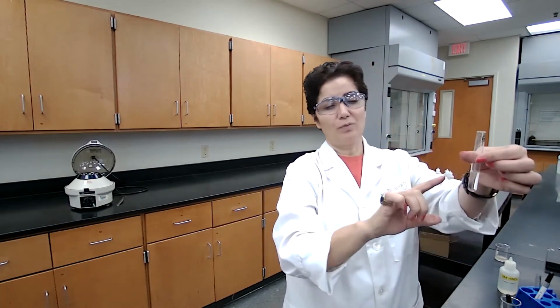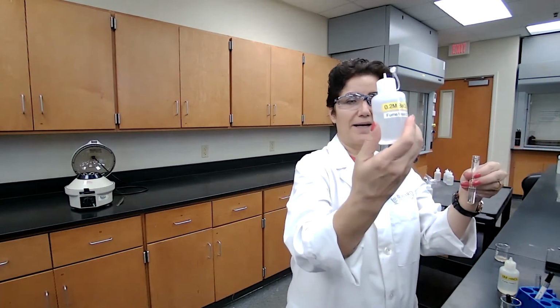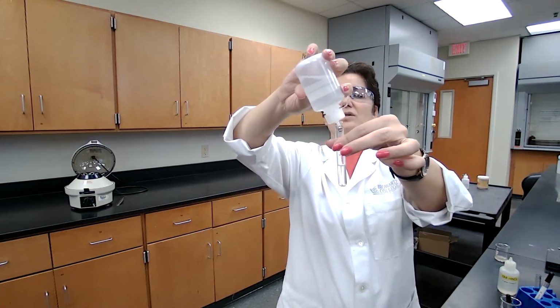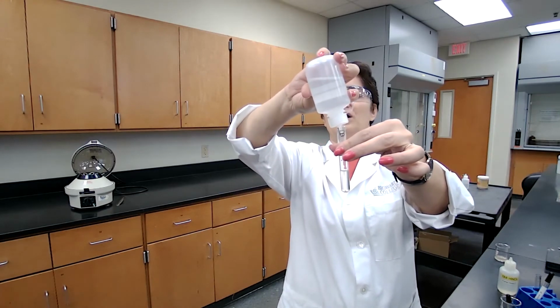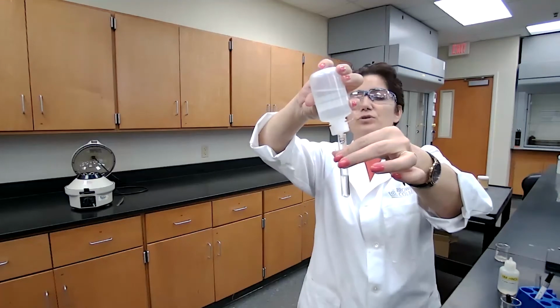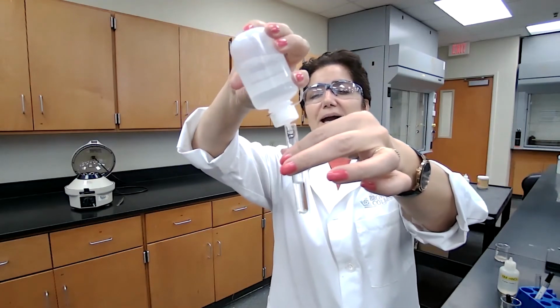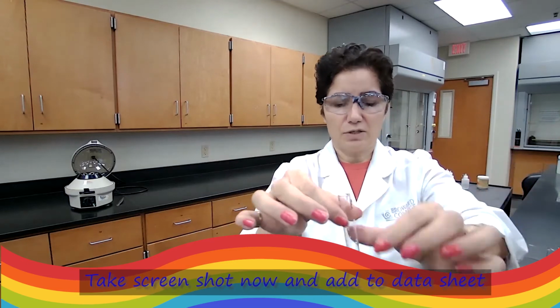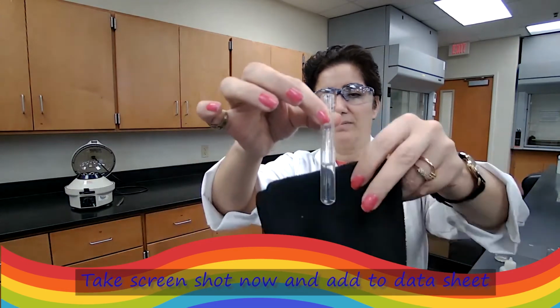The reagent that will show if the chromium ion is present or not is the barium chloride. If barium chloride is added to the solution containing chromium, a yellow, thick precipitate should form. And by adding the barium chloride solution, now I also hold the black background.